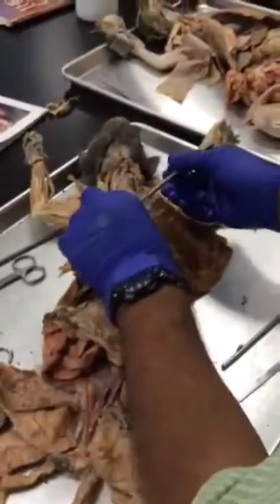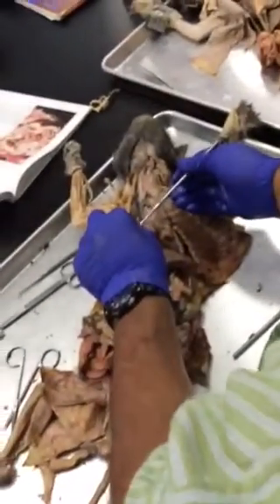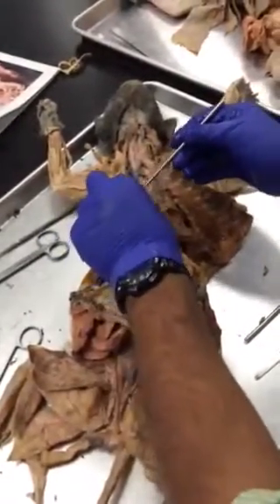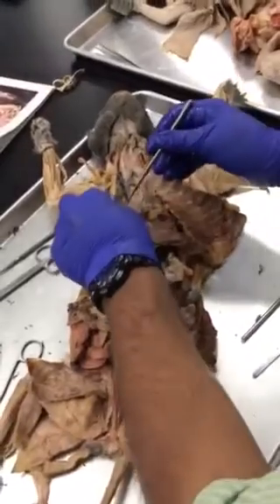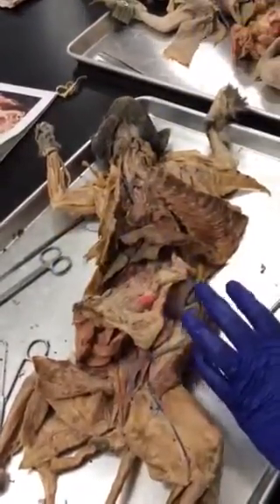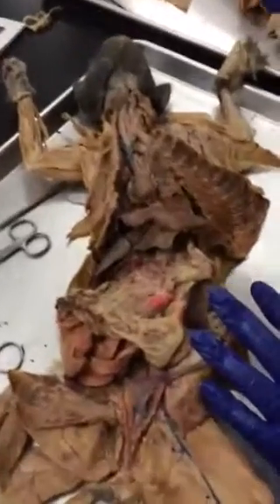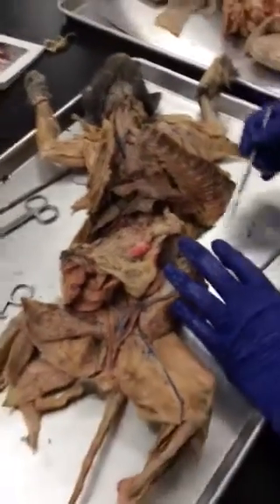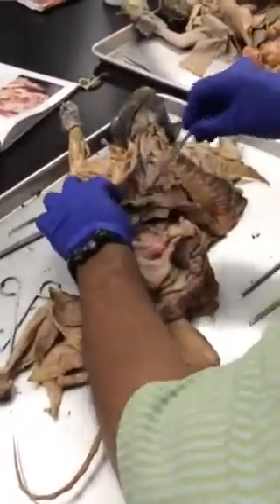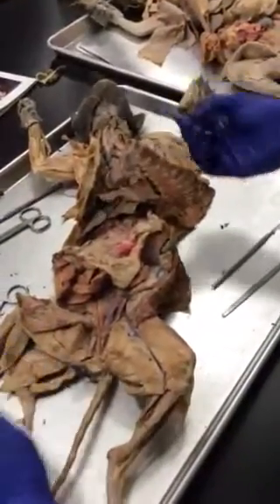The layers of the heart: this is the parietal pericardium. The visceral pericardium is attached to it — you don't have to worry about visceral. The gap between parietal and visceral is called the pericardial cavity.